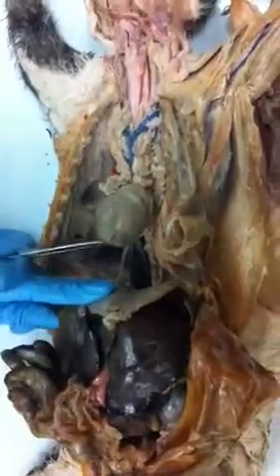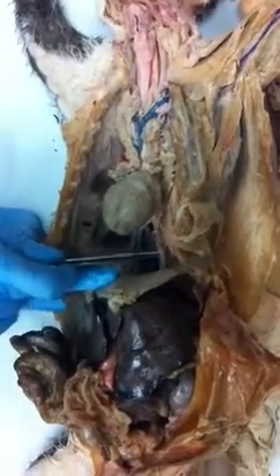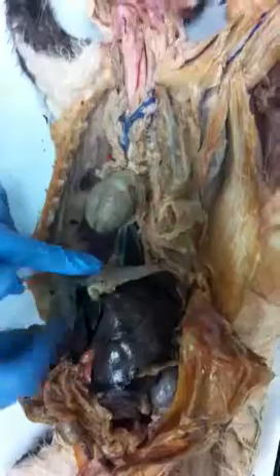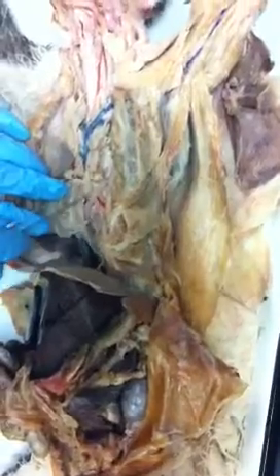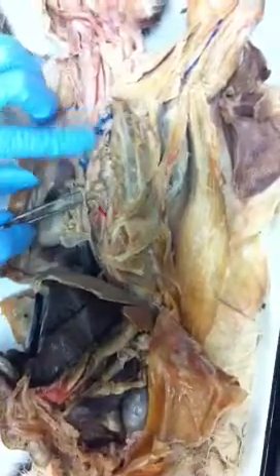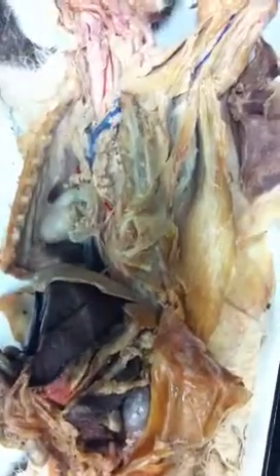and this white fiber right here, this white thread on this side. Here and here. Those are the phrenic nerves. You can actually follow those. Maybe, maybe not. Yeah, here it is. Phrenic nerve comes all the way up here. Goes all the way up. That innervates the diaphragm and allows your diaphragm to move all the way down.